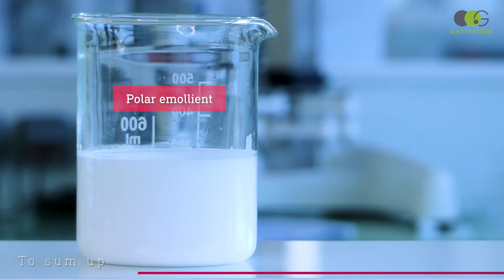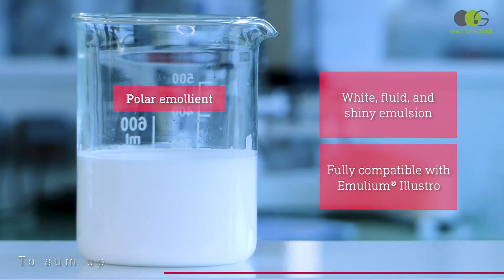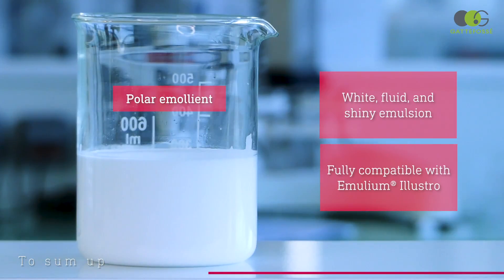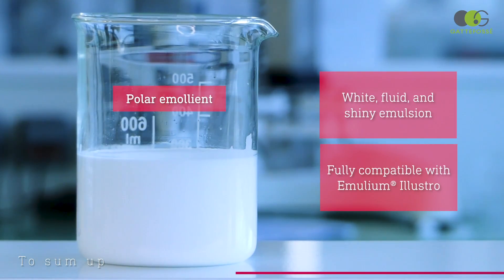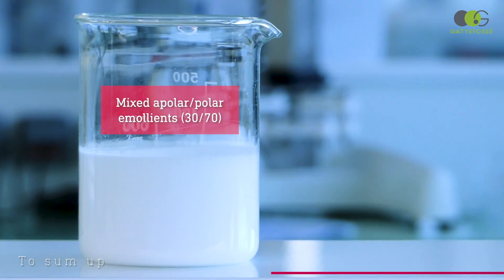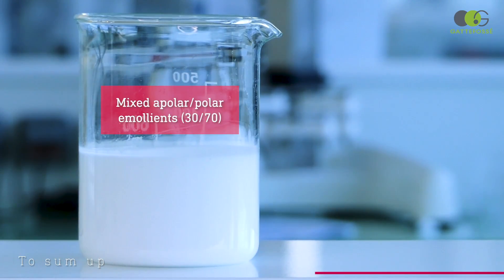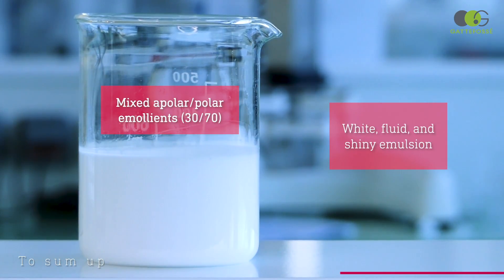On the contrary, the one done with the polar emollient is really white, fluid, and shiny. The emulsification is perfect, highlighting the excellent compatibility of our emulsifier with this category of emollients. Finally, the emulsion obtained with the mix of polar and apolar emollients was also successful, as we obtained a beautiful white and shiny emulsion.